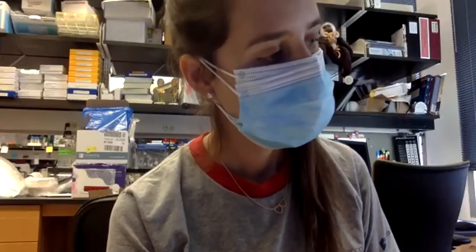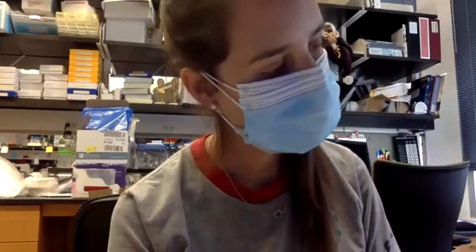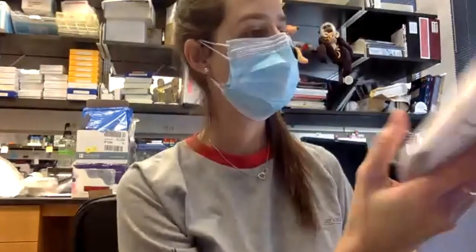Okay, so that's it with the experiment. The last step is to put the bacteria like this in the plate. And then we'll leave it at 37, and tomorrow we'll see if it worked or not. Okay, we have the activity here.